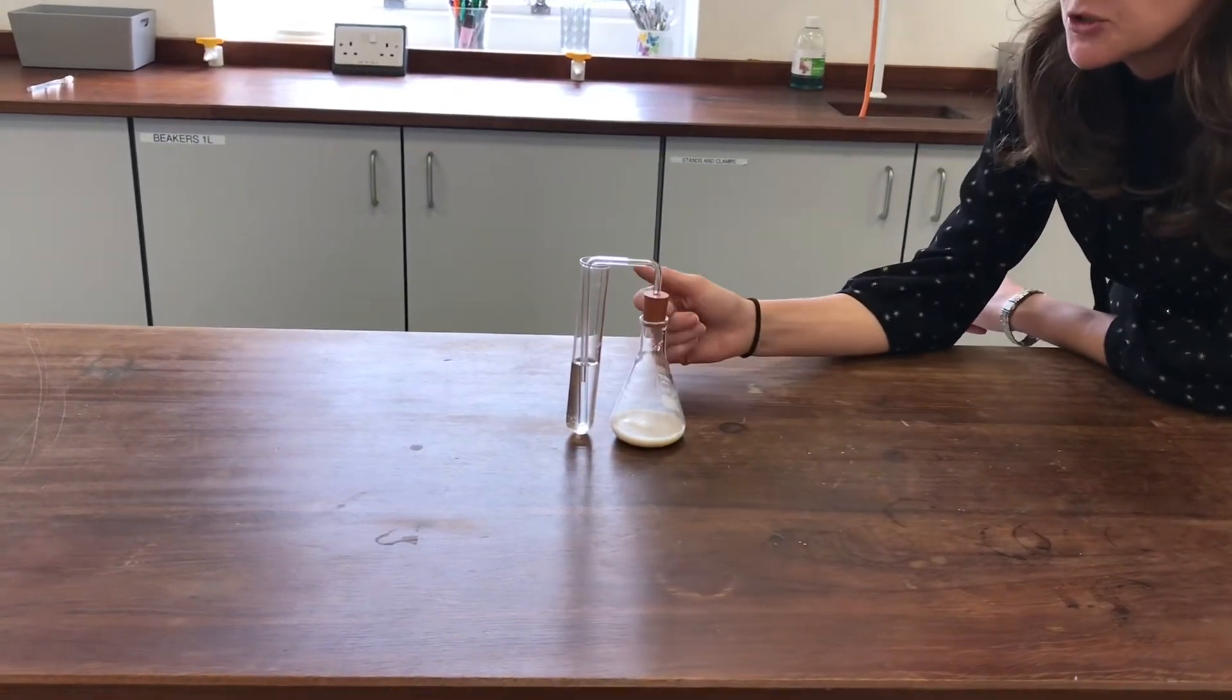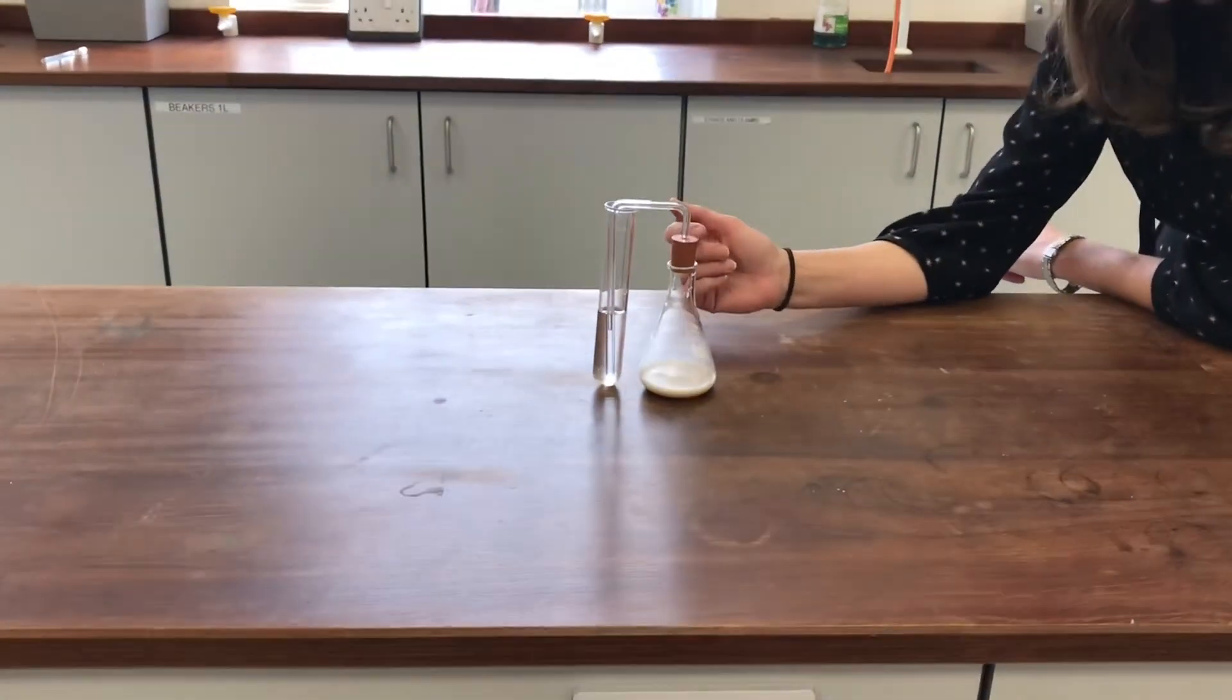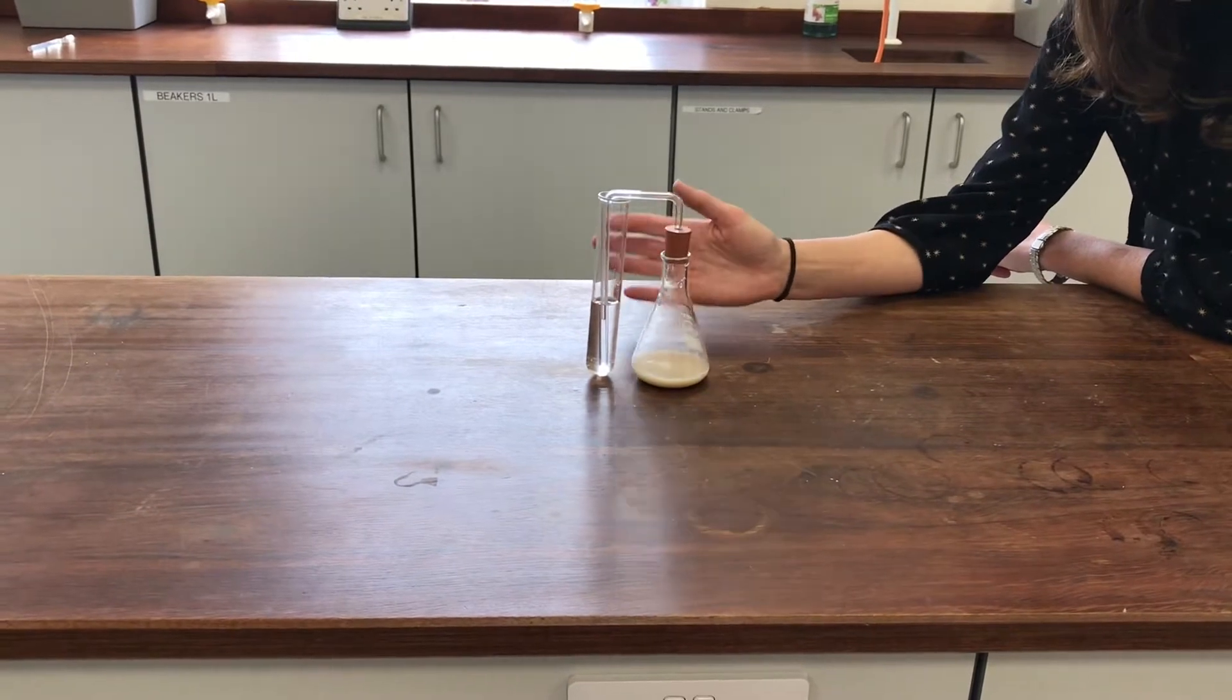Okay, so this is set up to demonstrate that carbon dioxide is released when we use yeast and sugar together.